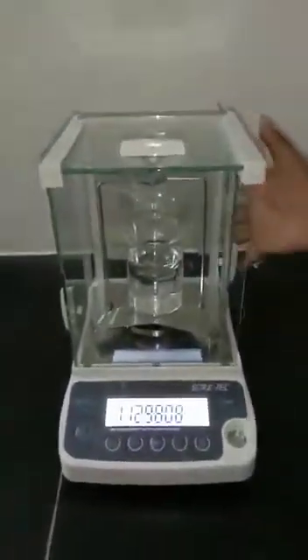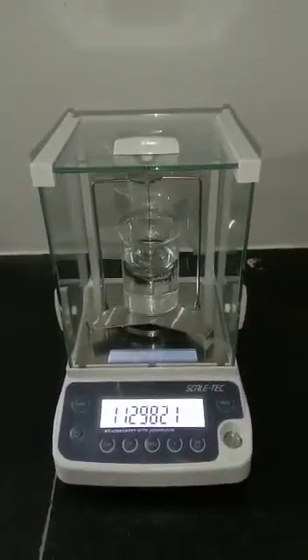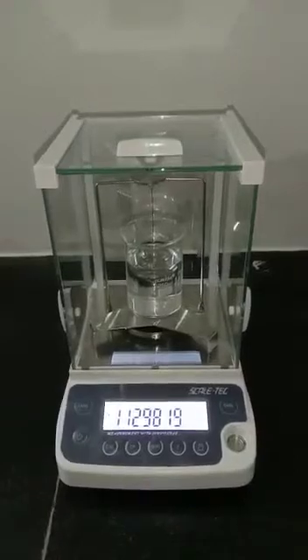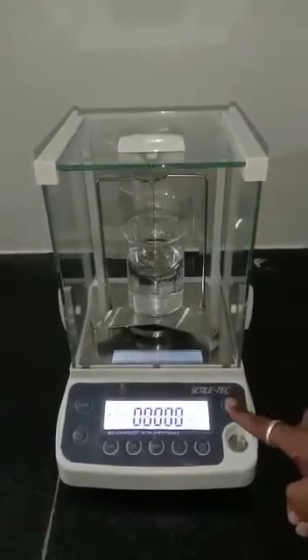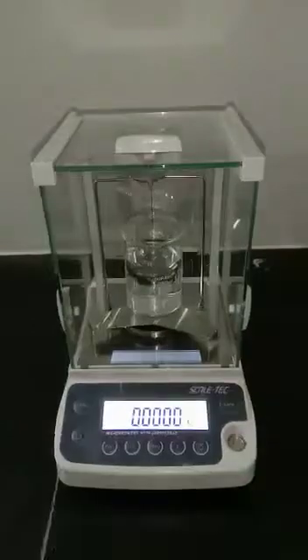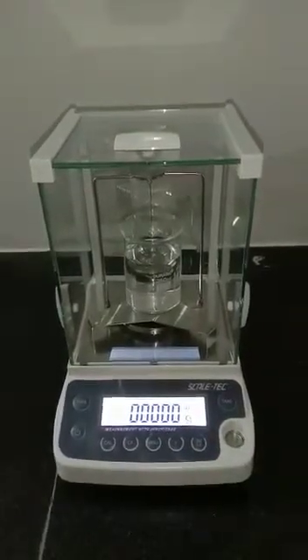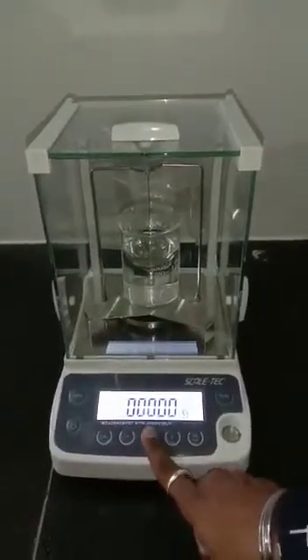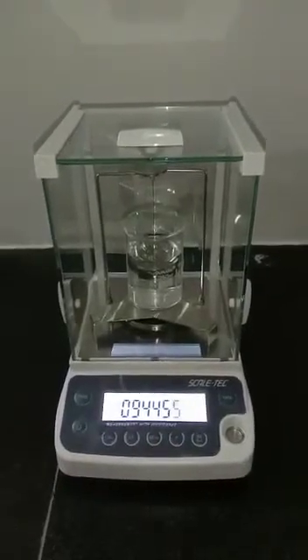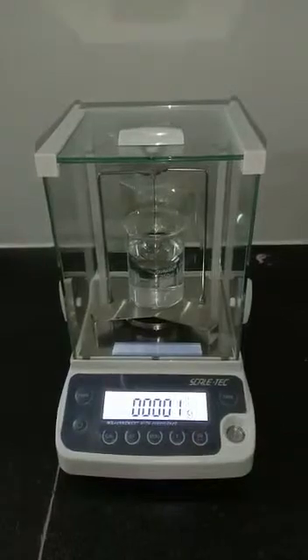Now close all the doors and wait until the digits are stable. Press the tare key. Now press F and you will get the density on your balance. Press menu — you will get the density of the particular liquid value you have entered. Now press F and you will get the weight in air.